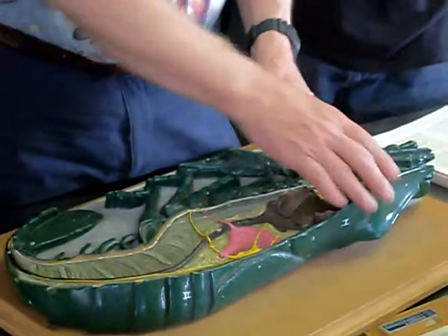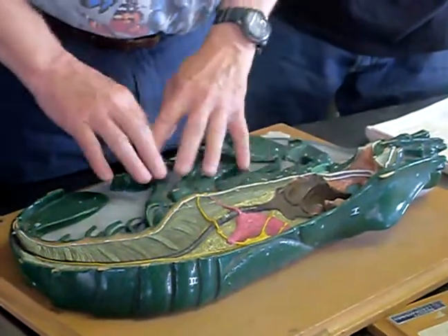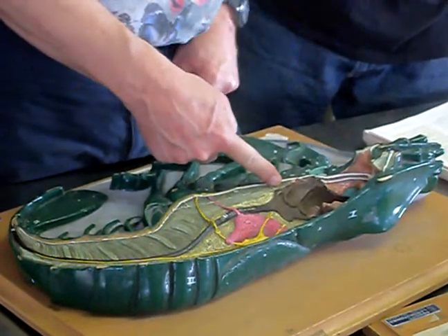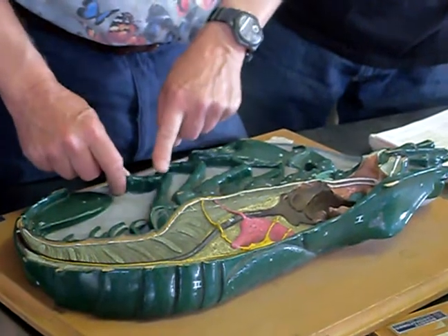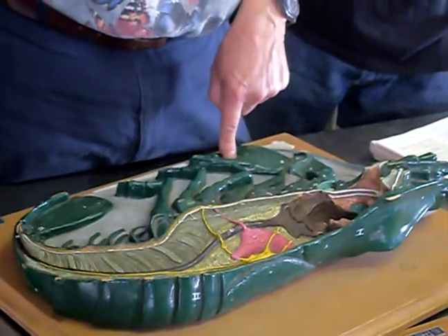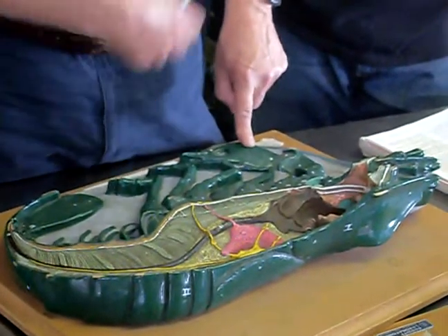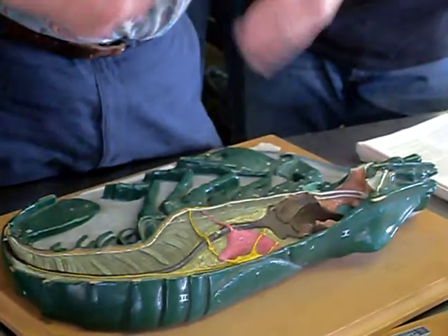As for external structures: the head goes to here, and then the thorax starts here. These appendages here are mouth parts. This long claw that you see is the first of five pairs of walking legs. The first pair of walking legs is modified into a big pincher — it's called a cheliped or a claw — and they use it for protection and for catching prey. Then the second, third, fourth, and fifth pair are just for walking, basically.